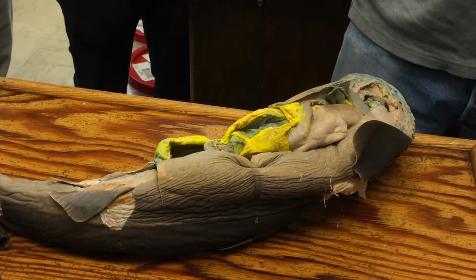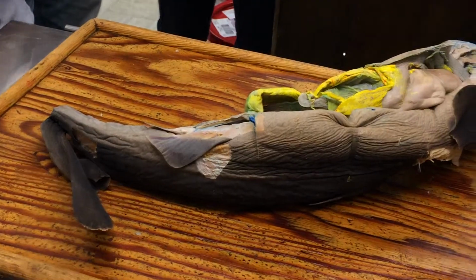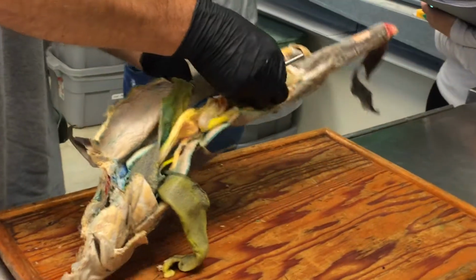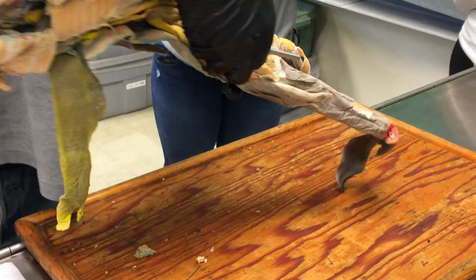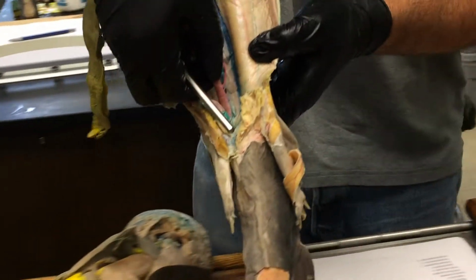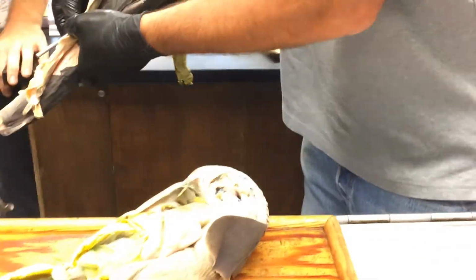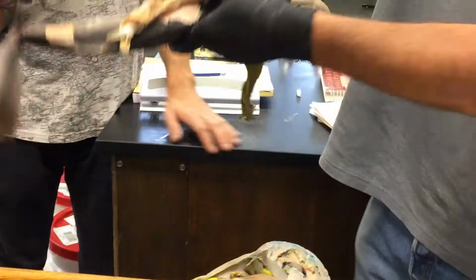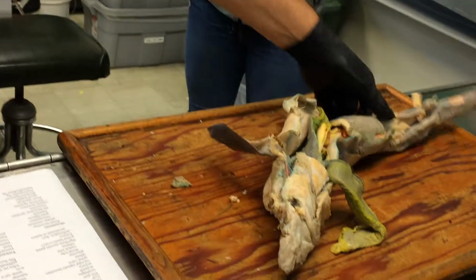So the mesentery proper. And then the last bit of dorsal mesentery in these guys, let's do it on here, it's easier to see, is the mesentery associated with the digitiform gland, and that's called the mesocolon, because this is kind of the last bit of the gut. Okay, so that's dorsal mesentery.